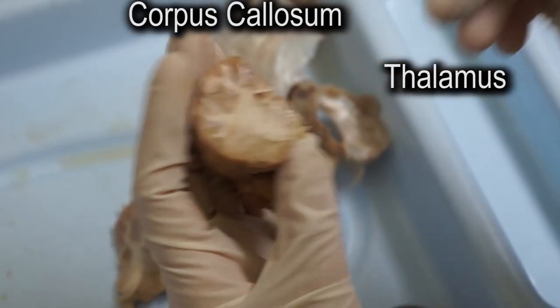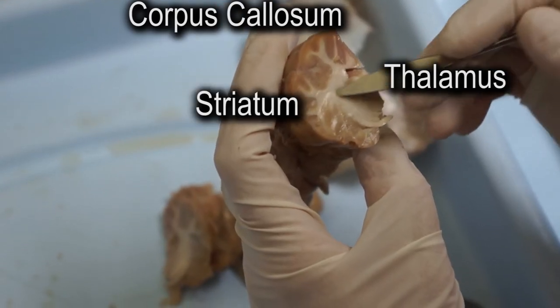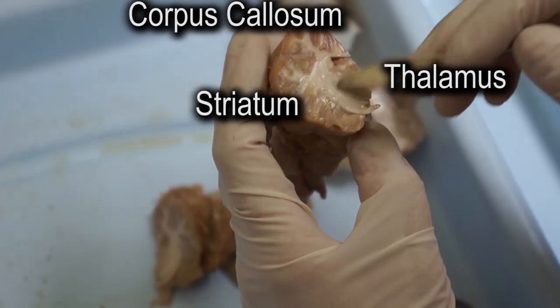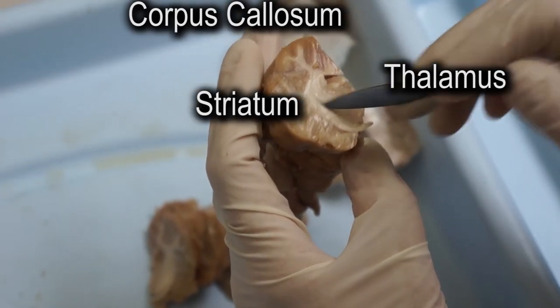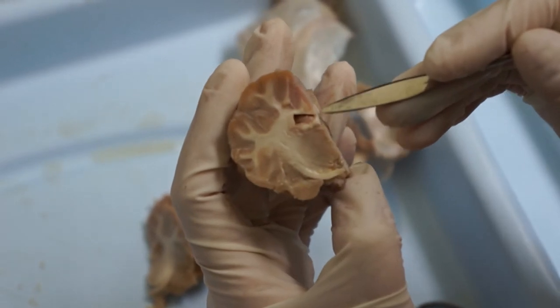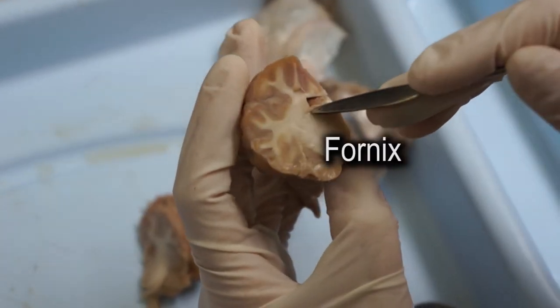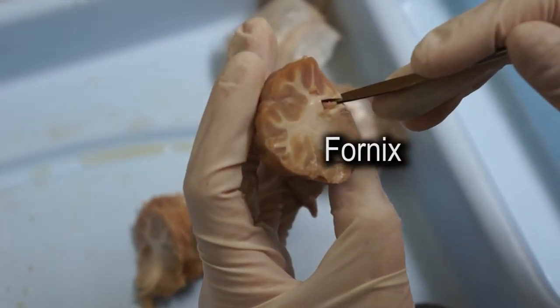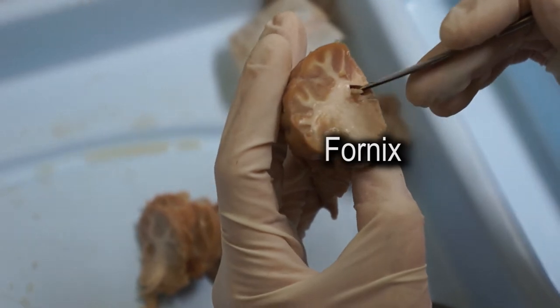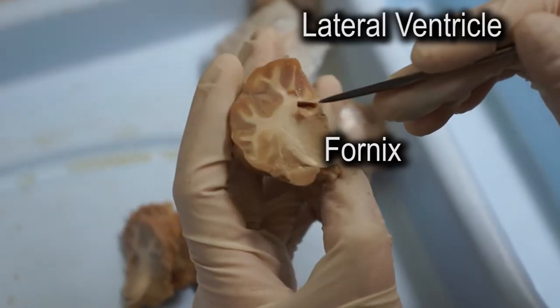That's the thalamus? That should be the striatum then, right? Yes. Do you see there is some connection? And then? That's the fornix. And what is this — the space? Lateral.